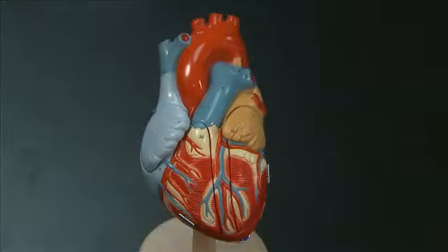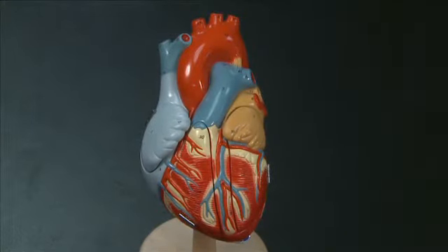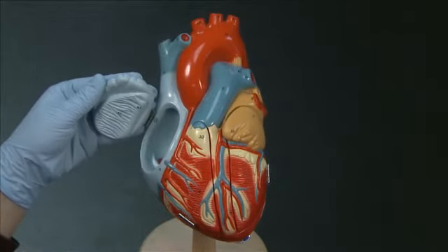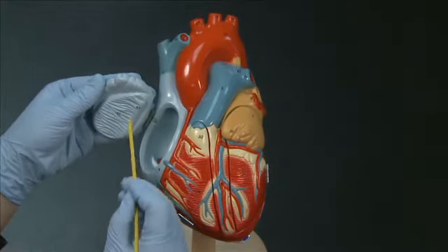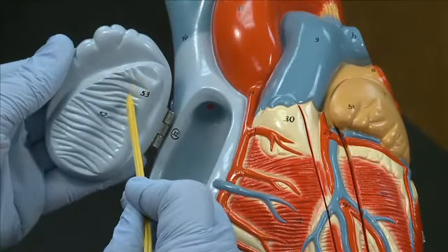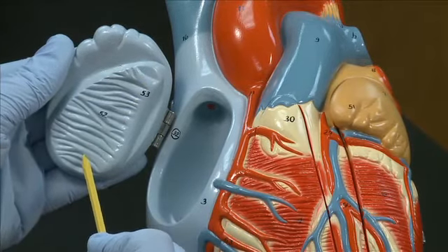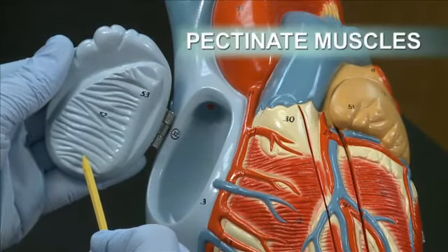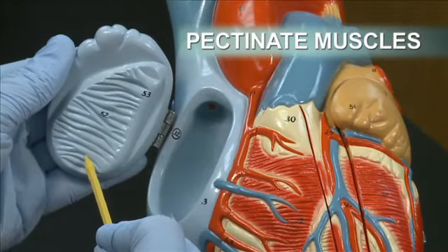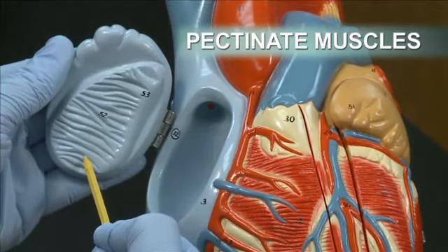Now we'll look at the interior features of the heart. The first thing you'll notice on the interior of the atria is that the anterior walls are lined by these ridged muscles, and we call those pectinate muscles. Pectinate comes from the word for comb because it looks a little bit like a comb.